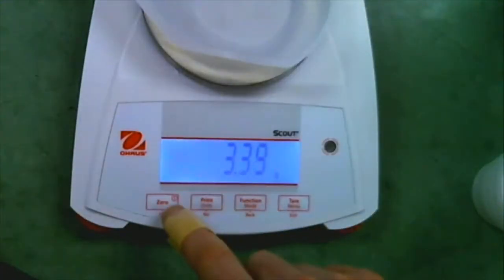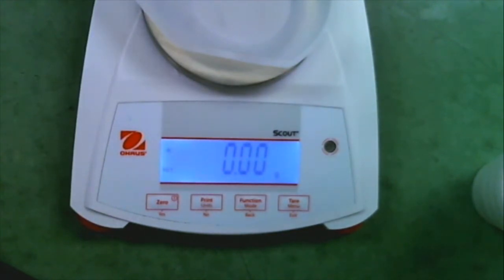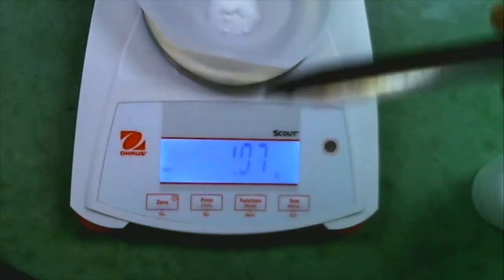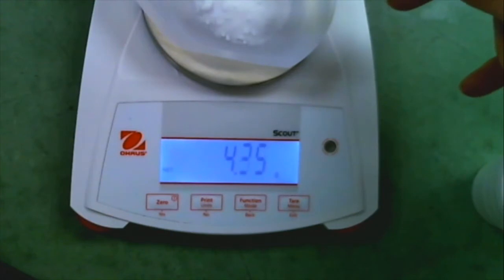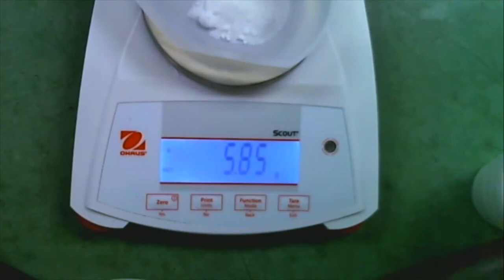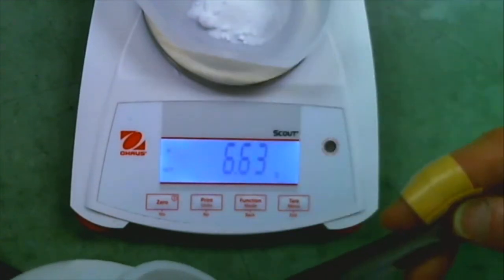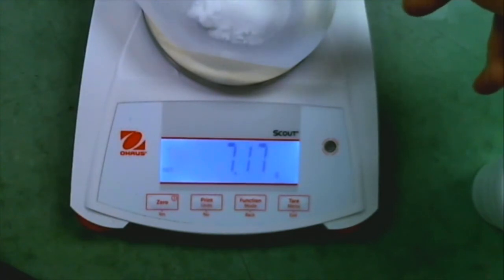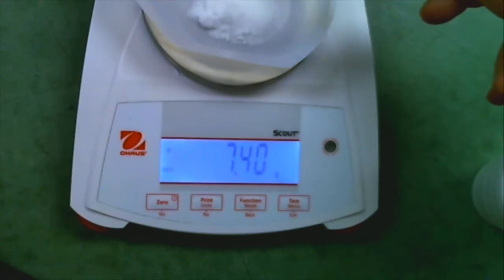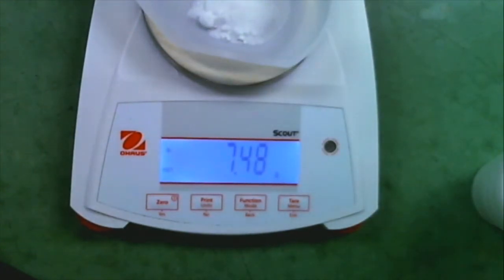Our first solute is going to be potassium chloride. We have 7.48 grams of potassium chloride weighed out.